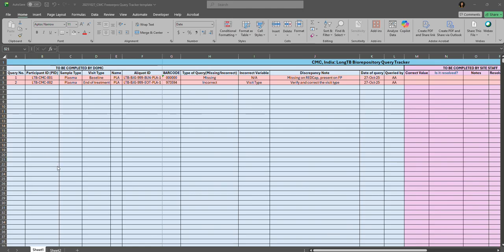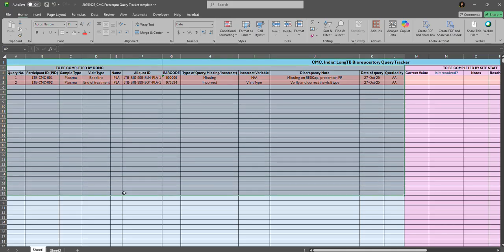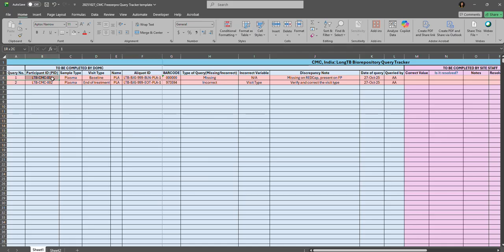Workflow for this log is: once the DOMC staff identifies the discrepancies, they will open the queries in the to be completed by DOMC section. All the open queries are highlighted in red. The fields in this section include a query number, which is used to reference the query. The fields participant ID, sample type, visit type, name, aliquot ID, and barcode are the identifier fields for the sample.